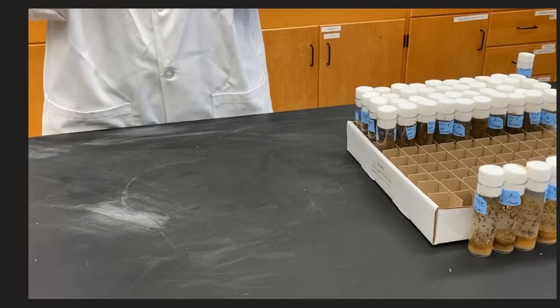We typically keep our enhancer trap lines in vials and the stocks in bottles, as the lines can be low producing and the food can get moldy quickly if not being eaten and churned due to low numbers of flies and larvae.